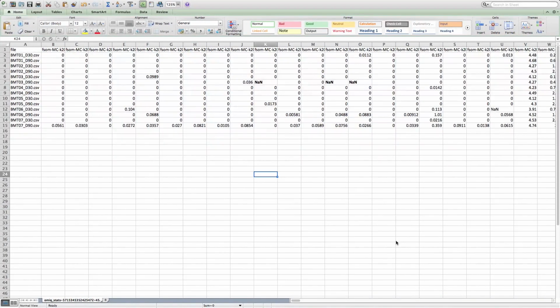When we open up the CSV file that gets given to us, we can see immediately that there are in fact NaN values, and we can see where they come from. In this case, one that we're dealing with is this file here, and it looks like that cluster number 10 on that file is empty, and so it gives us an NaN. So in our case, what actually gets fed to SAM would be a 0 here, and the same goes for all of these.